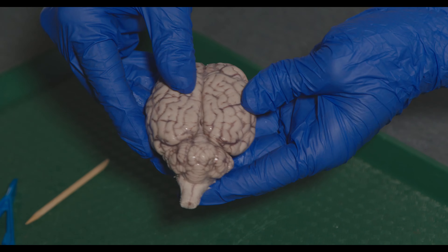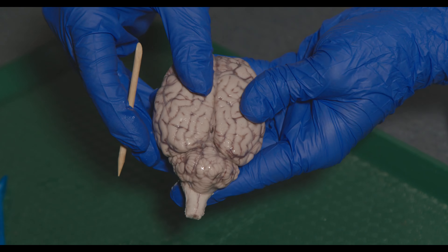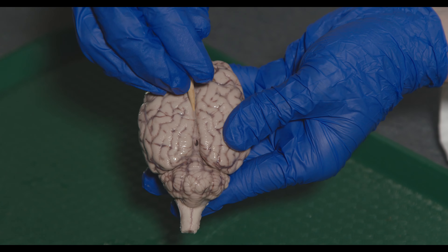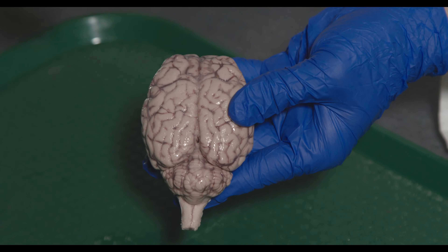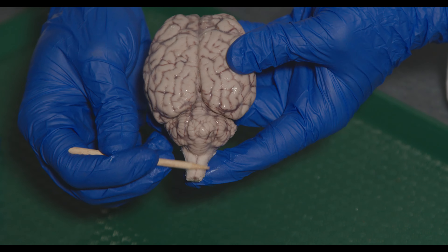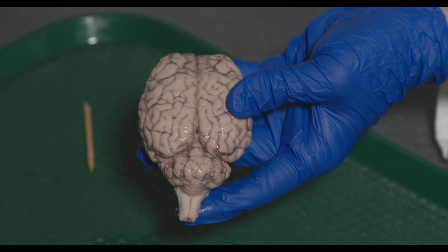Flipping to the dorsal side, we can see the longitudinal fissure — it's slightly stuck together due to the arachnoid mater — but this is the large groove that separates the two hemispheres. We can also see the cerebellum down here and the spinal cord connecting to the brain stem.